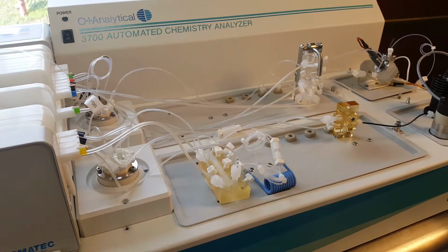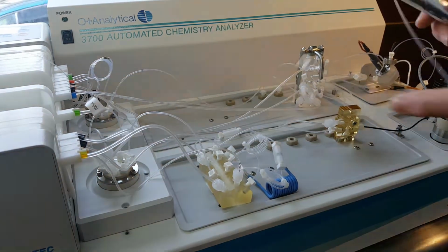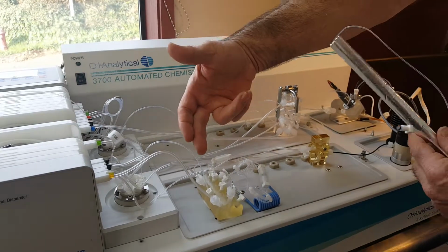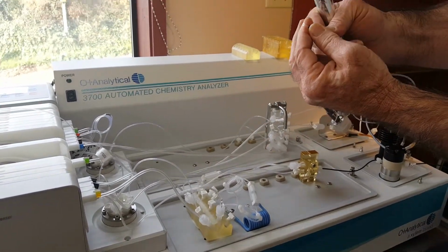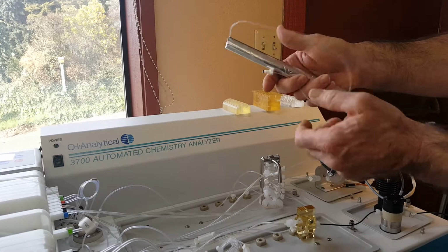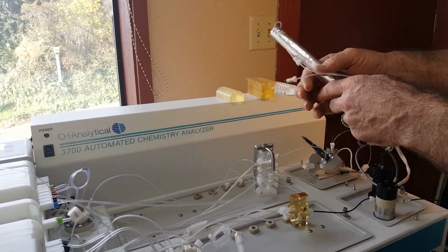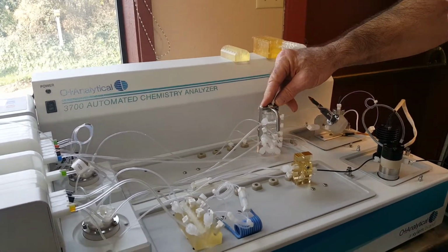Now, I should mention that on our UV module, we do use a different type of tubing. Like I've mentioned before, all of these use an FEP flanged fitting, which is a chemically inert O-ring, so it seals quickly and easily and never leaks. We use a slightly larger OD tubing to accommodate all the nasty things that people have often in cyanide samples.